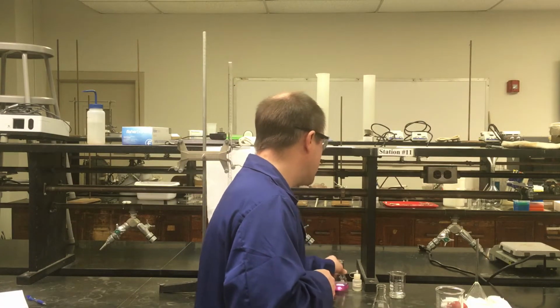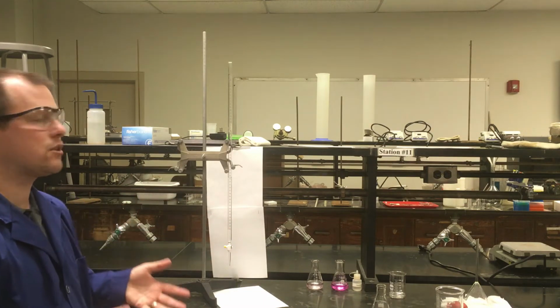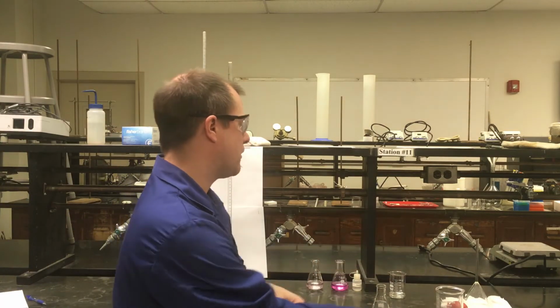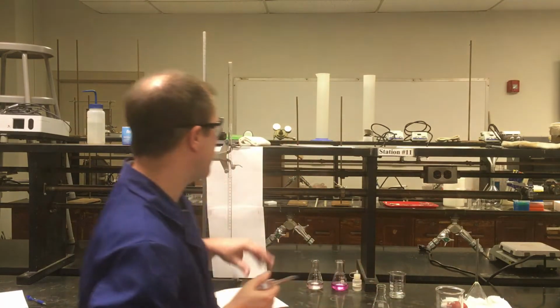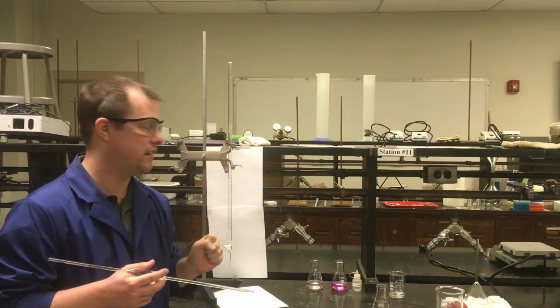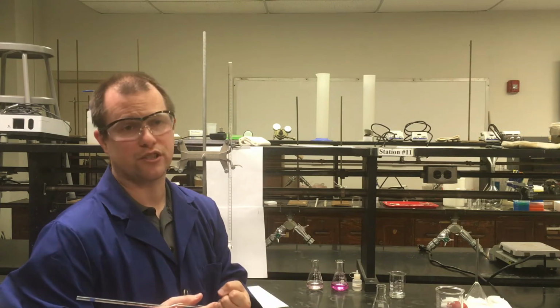And what I'm going to do is just walk through all of the steps of this procedure to hopefully get us to that point. So the very first thing we're going to do for this reaction and titration and our overall procedure, we're going to be measuring out the amount of the hydrogen tartrate we're going to use. Because even if we know the volume and the concentration of the hydroxide, and I'll show its concentration in a minute, we still need to know the volume of our hydrogen tartrate solution in order to know what its concentration is going to be. Right?